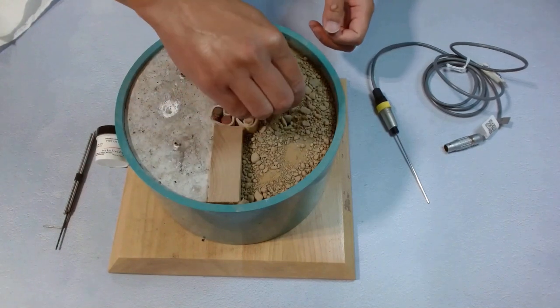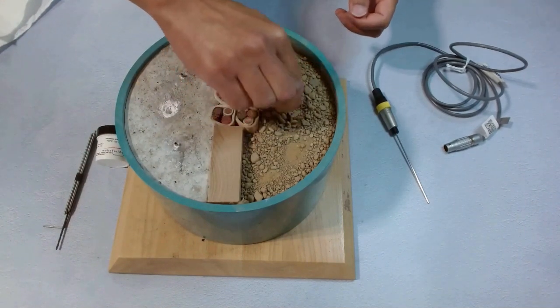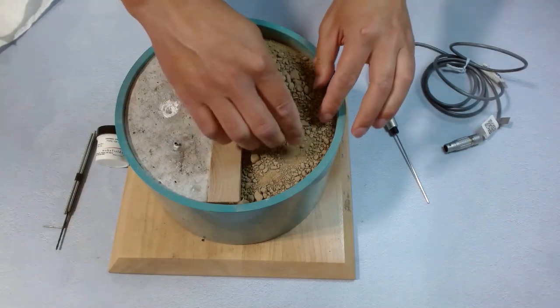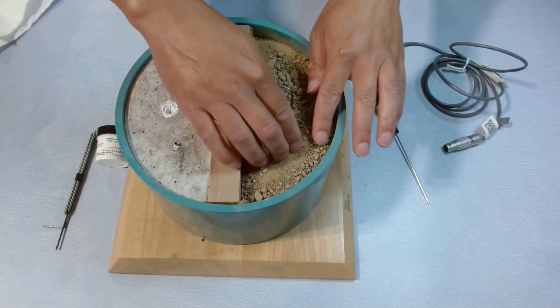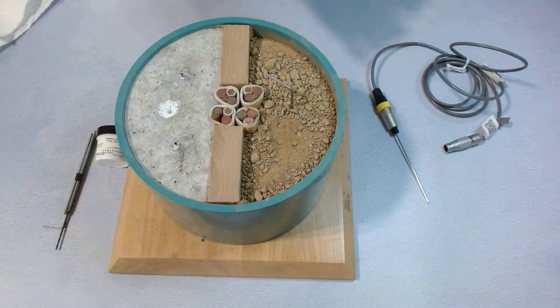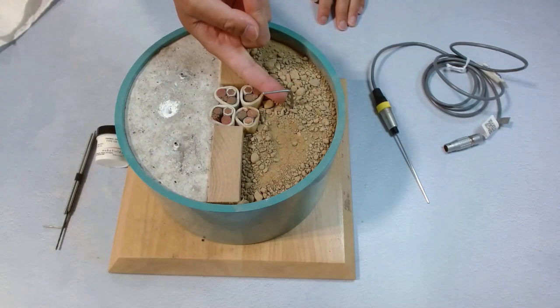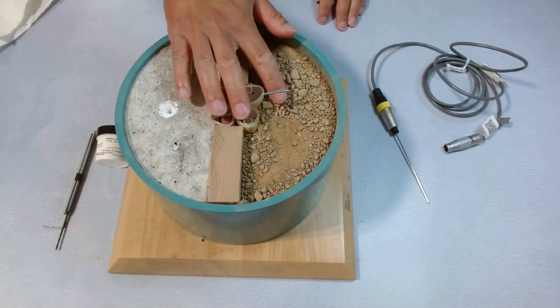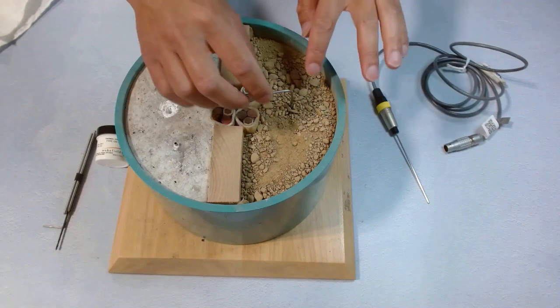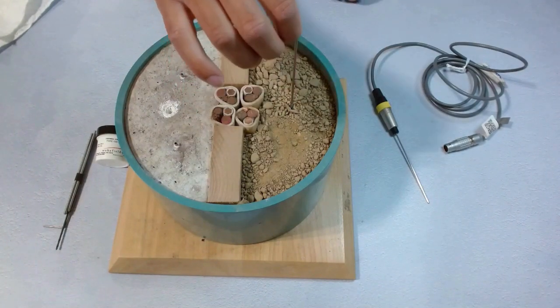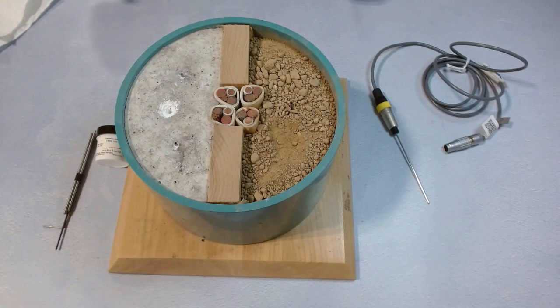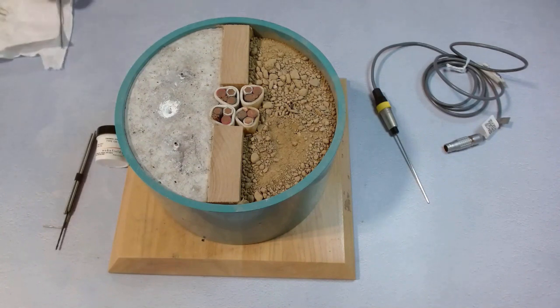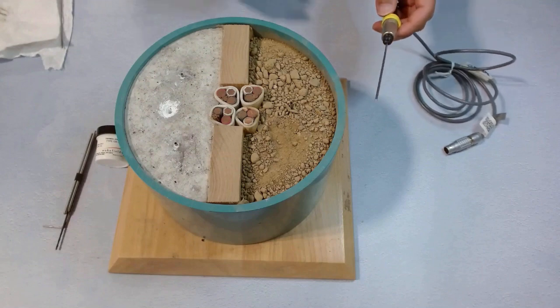This one doesn't have any sensor in there, so we can push it pretty hard. Let's push all the way in, just leave a little bit so the dirt and other stuff doesn't go in the needle sleeve. We should push as much as we can, because if it's not deep enough, part of the needle would be measuring air, which gives a lower result.